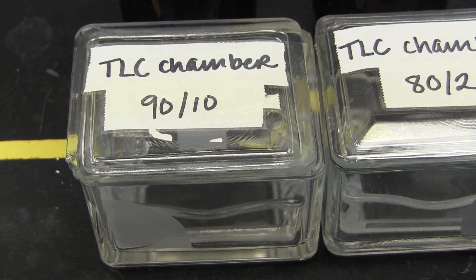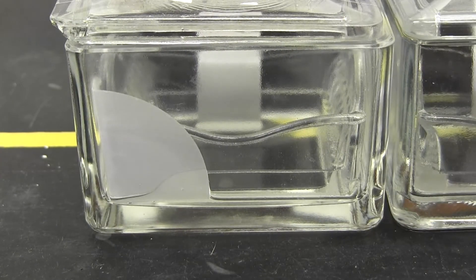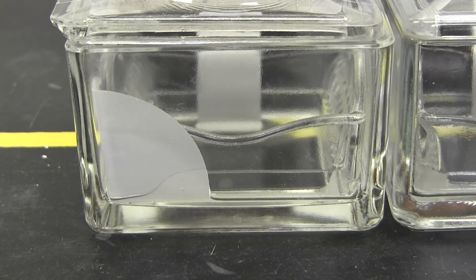Make sure the solvent does not sit above the line you drew. Wait until the solvent has run up near the top of the plate. Do not open the chamber until that point.